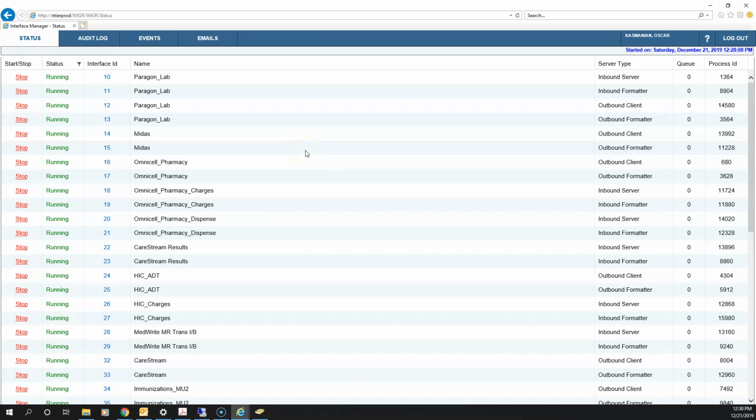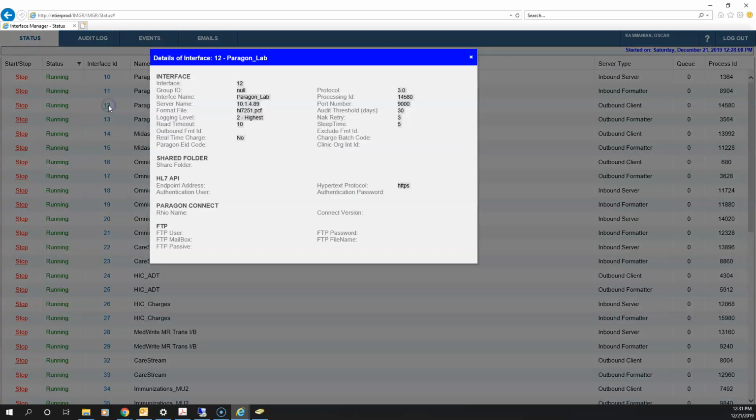So another issue I know is going on is the inability to locate the DI. Which isn't anybody's fault. We have changed the name frequently. I think the name is DI2 now. We've changed the IP, right, since we were on downtime. DI1 is DI2, or the IPs have changed. So what I like to do to make sure that I'm logging into the right place is click here on the 12, and this will give me the details for the interface, right?